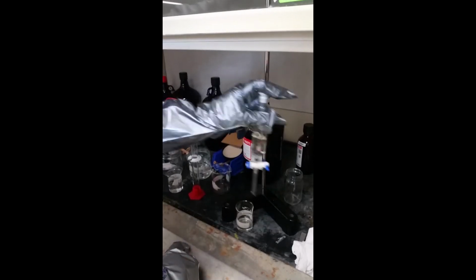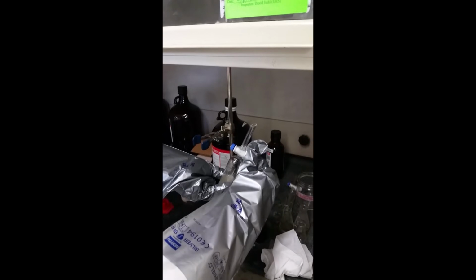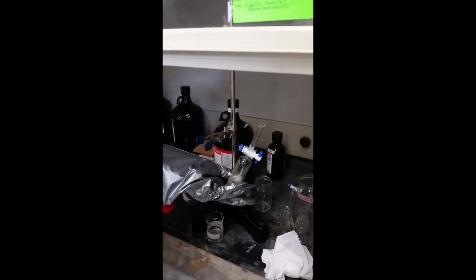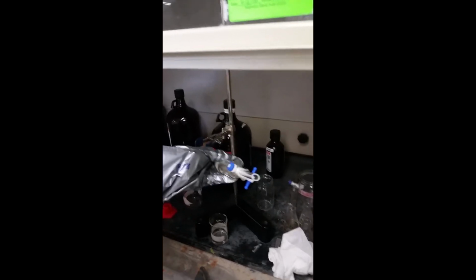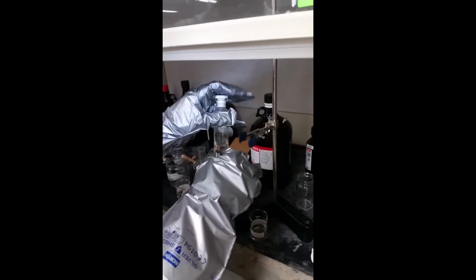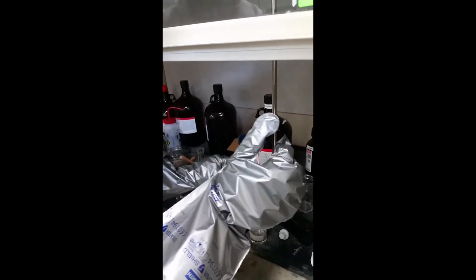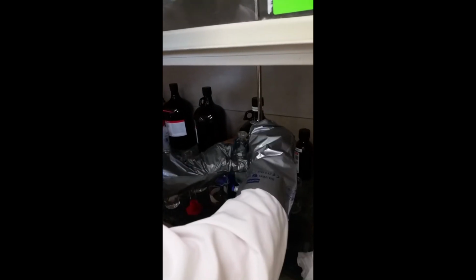We did 3, 5, 7, and 11 inversions. And while the funnel is still facing up, the separatory funnel is opened so it can degas. Then one final inversion is done very slowly so that no mixing occurs, and the 2 separate liquid phases are allowed to separate. The separatory funnel then is placed back on the stand securely, and the bottom layer, which is the dichloromethane with the newly extracted caffeine, is decanted from the bottom into the collection beaker.